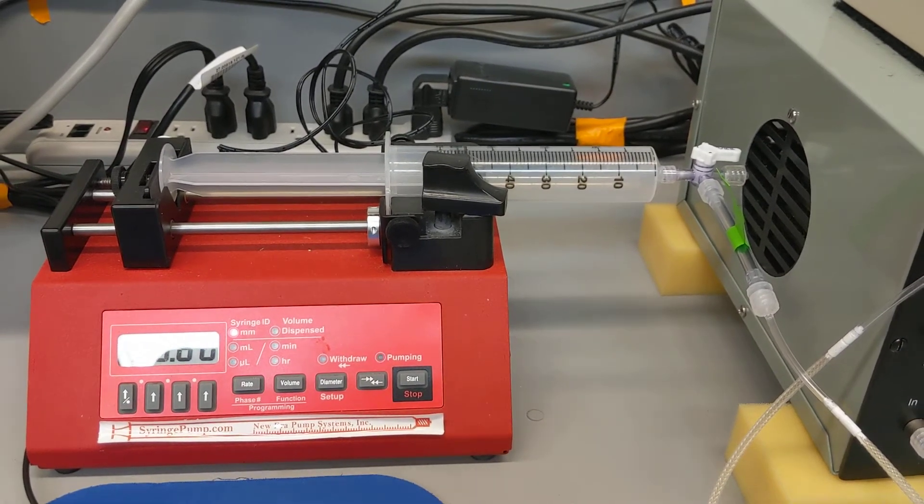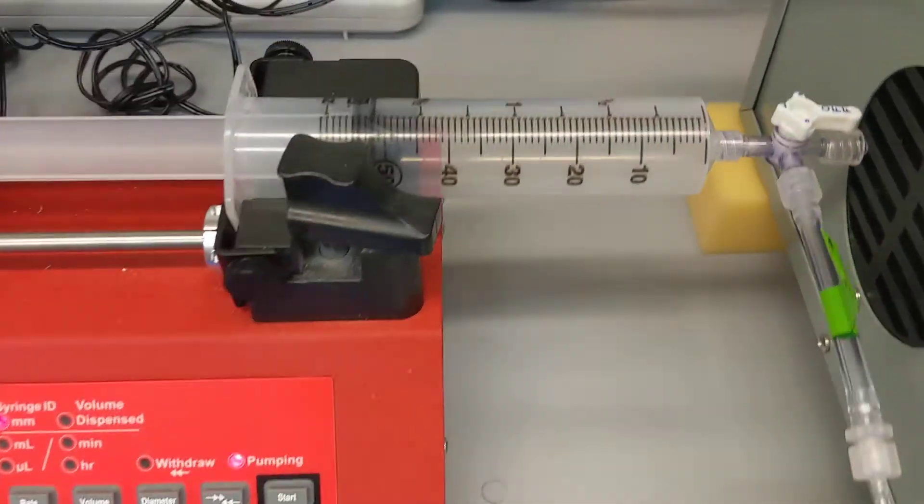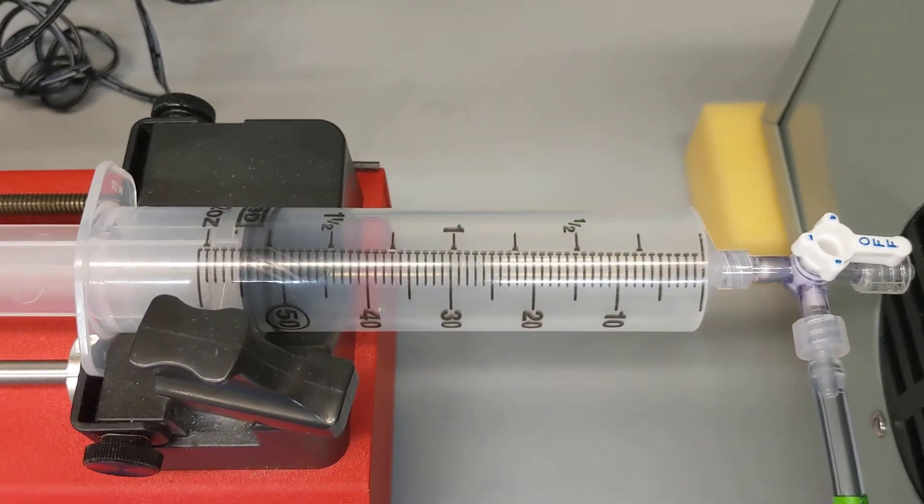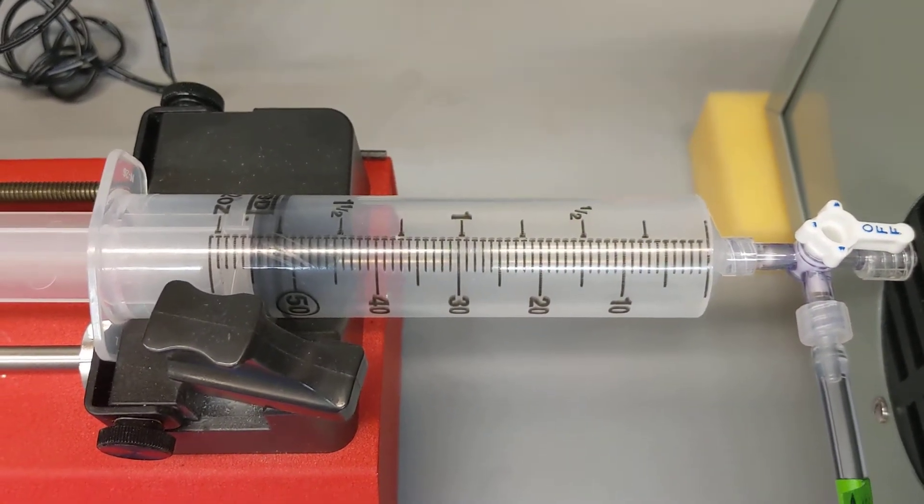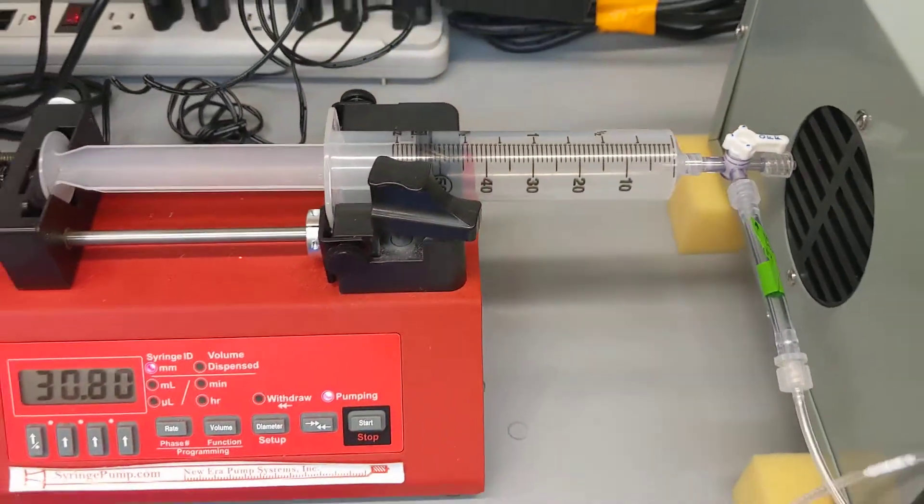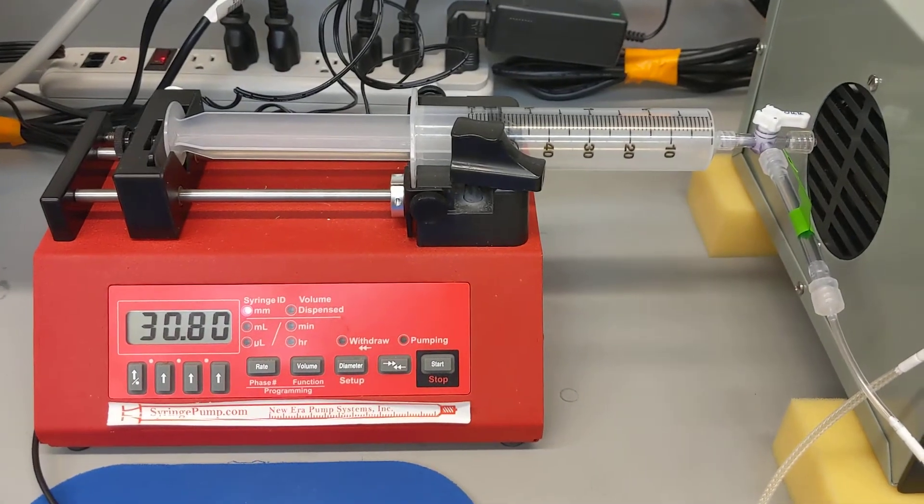So now I have that 50 milliliters of the air sample pulled from the salamander chamber, and it's set up into the specialized thing that's called a syringe pump.